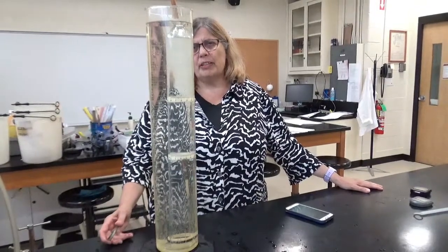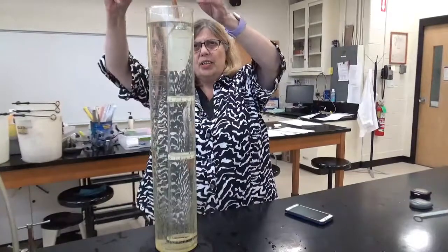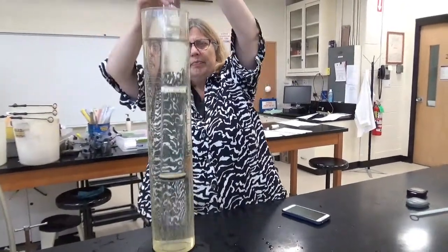What would you say about the rate or the time it takes the air to flow versus the time for the natural gas? What's the difference?